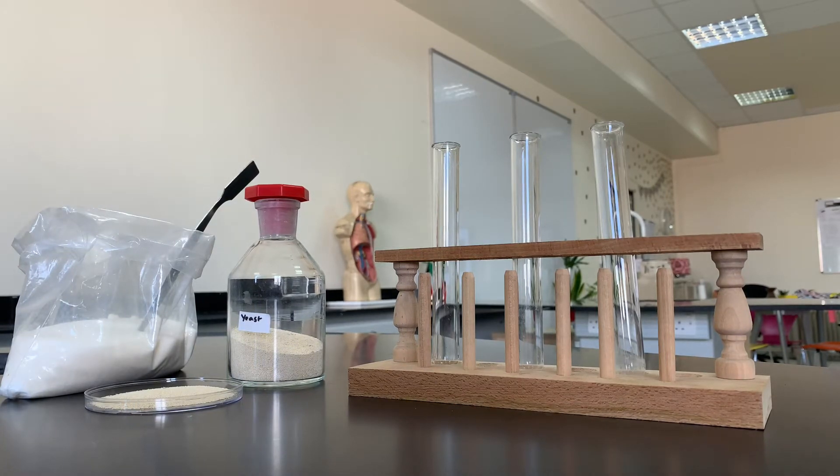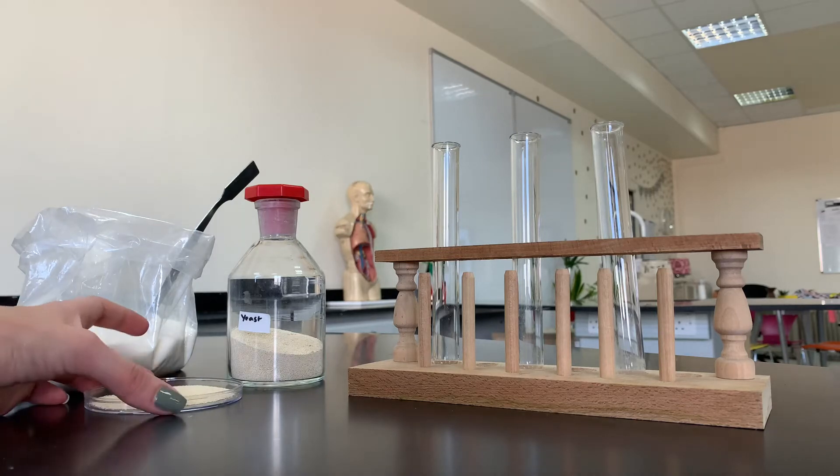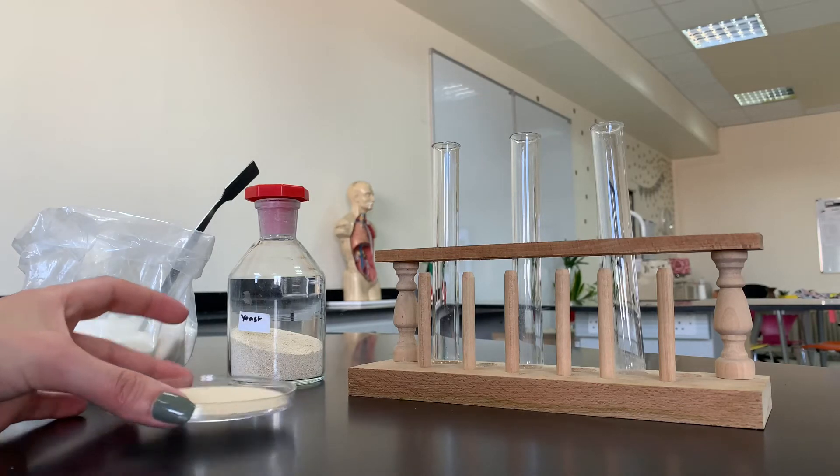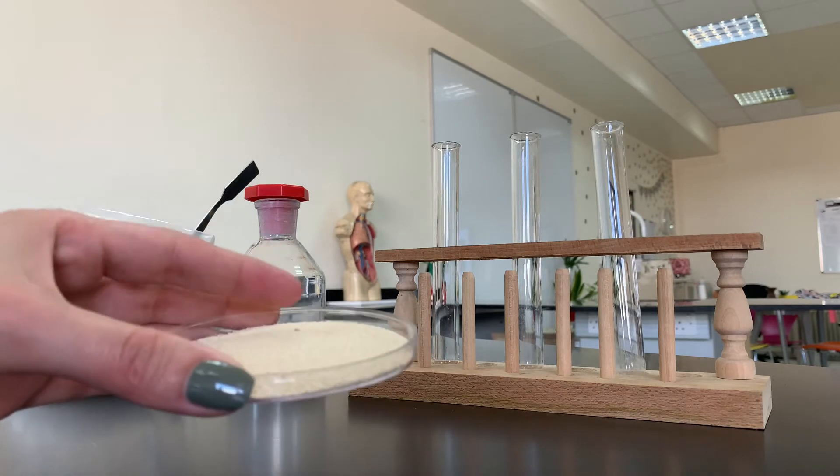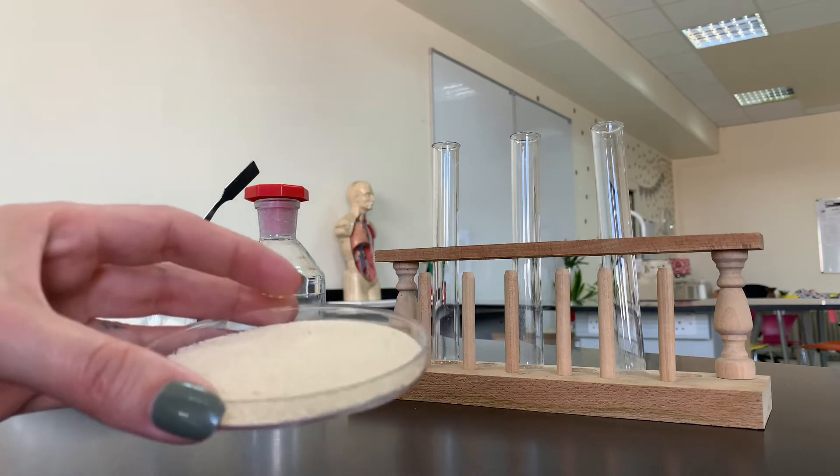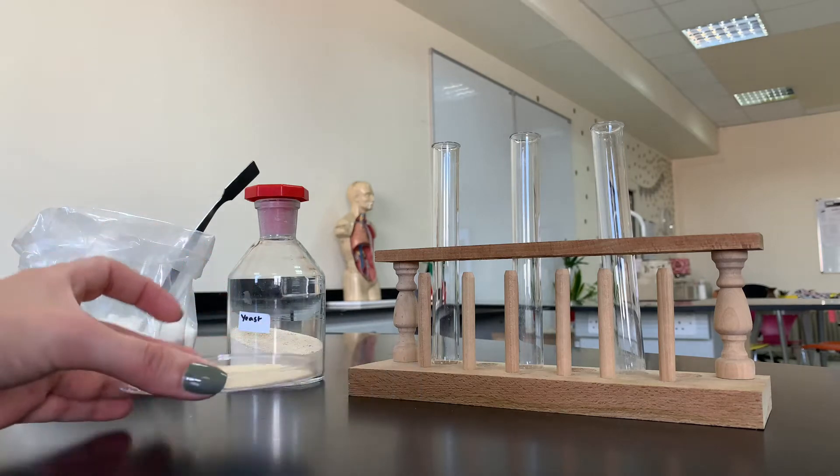As you can see here, every one of these tiny particles contains hundreds of different yeast colonies.